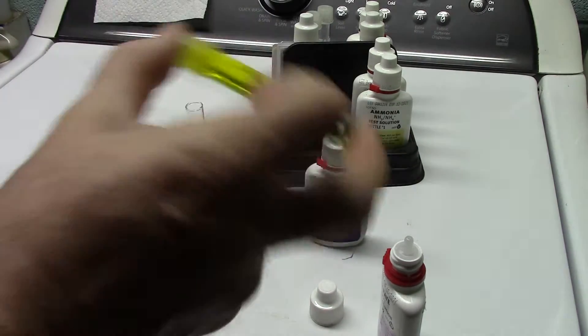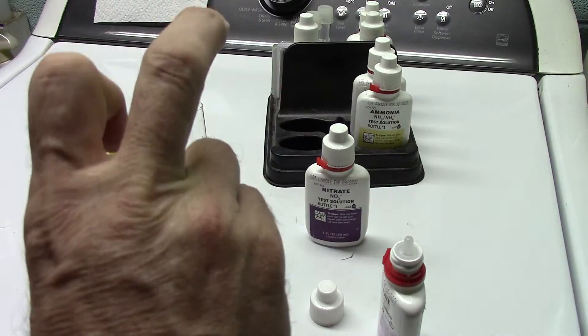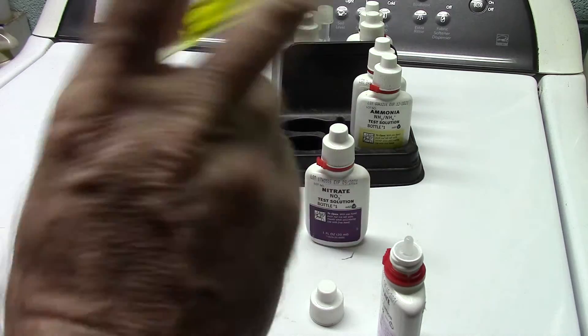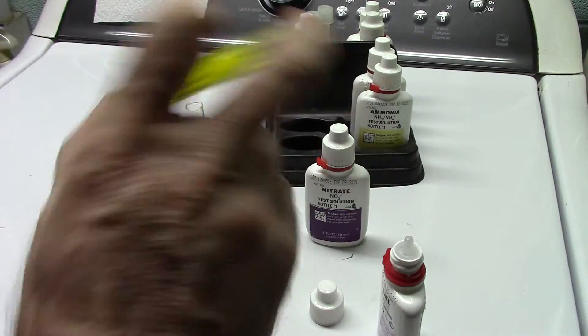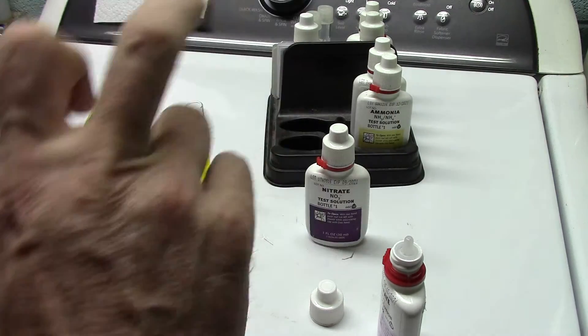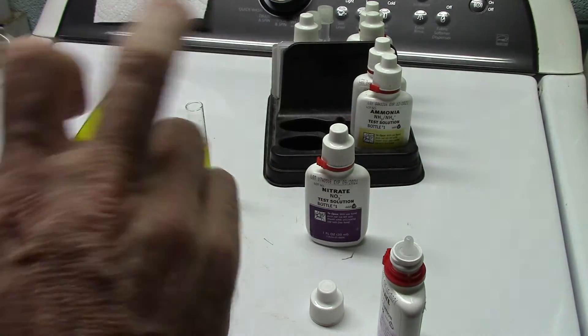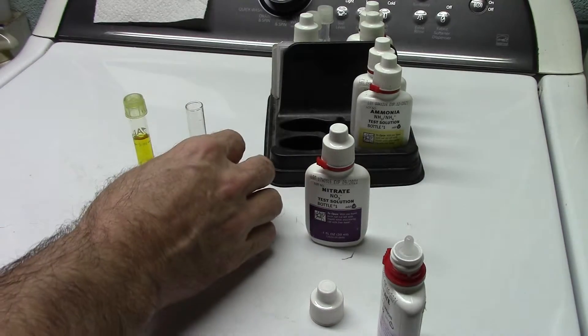Alright everybody, we're going to do another little experiment here tonight with my nitrate tests. I've got both these vials prepped, they're ready for their second reagent, so we're going to mix that one for 10 or 15 seconds.